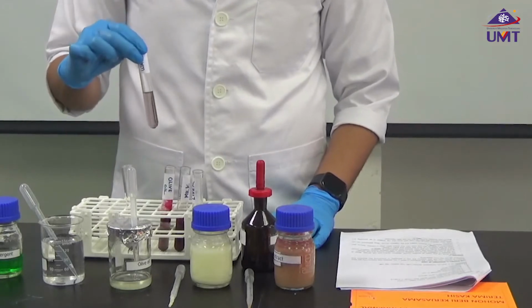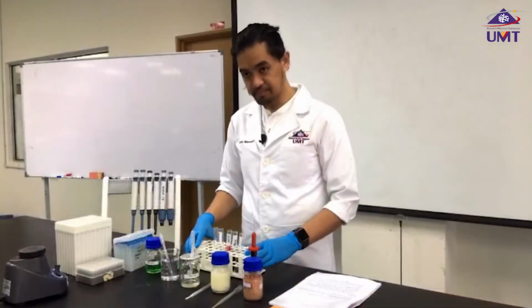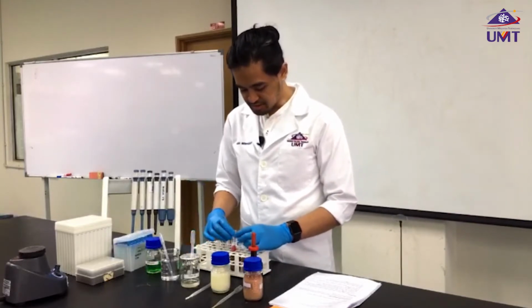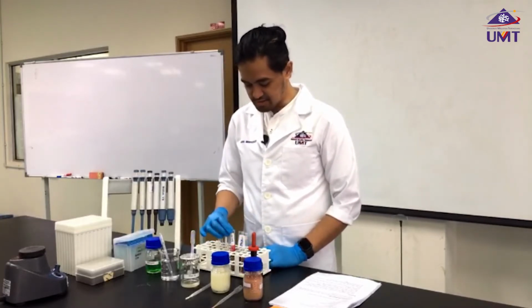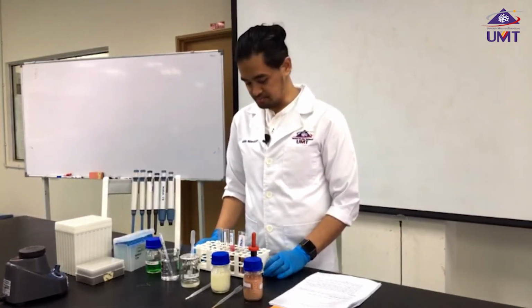And this is our water. So based on the findings here, please write down your observations in the report. And of course, please determine what is your positive control and what is your negative control.